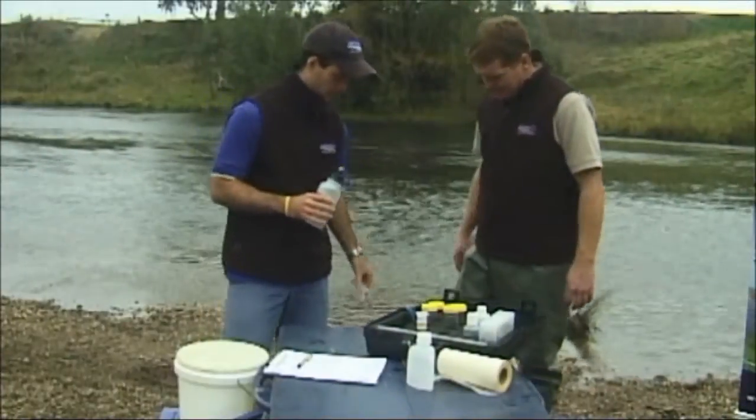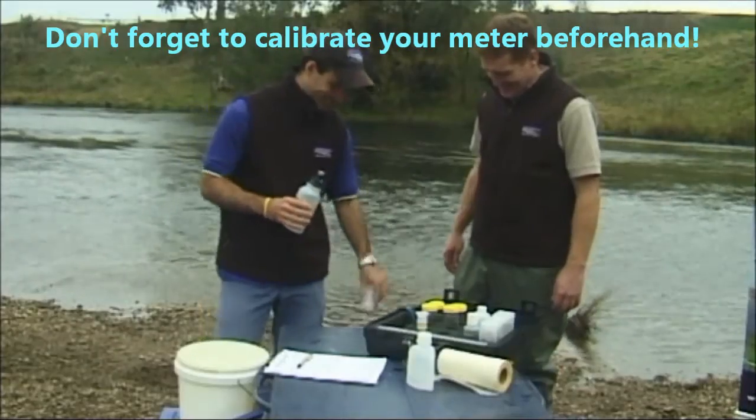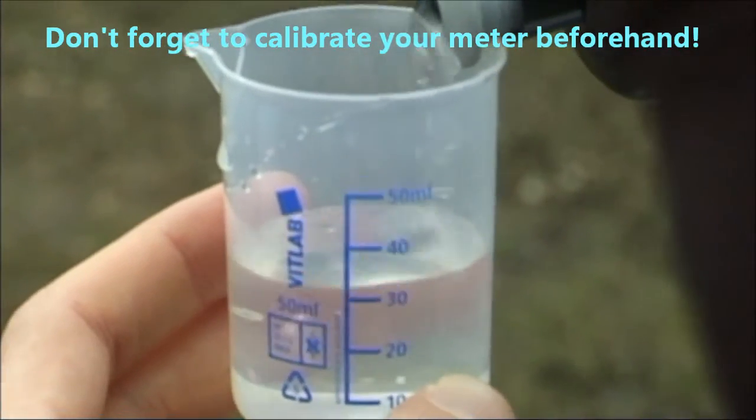Rinse out a specimen container with sample water at least twice. Shake the water sample and pour sample water into the specimen container.